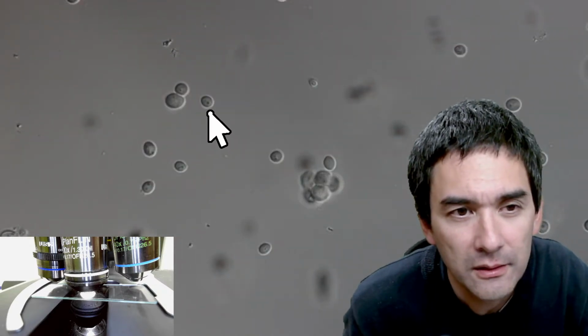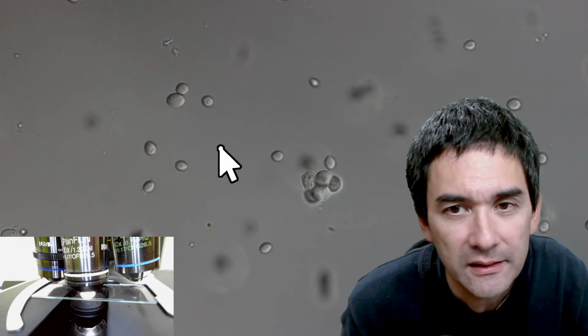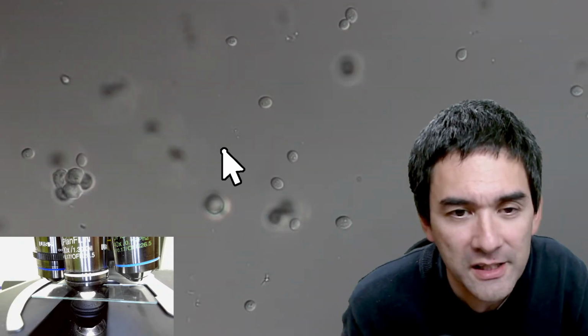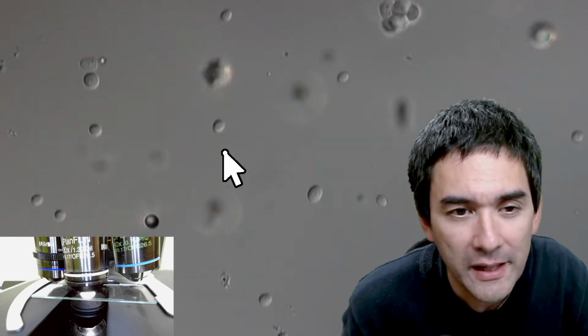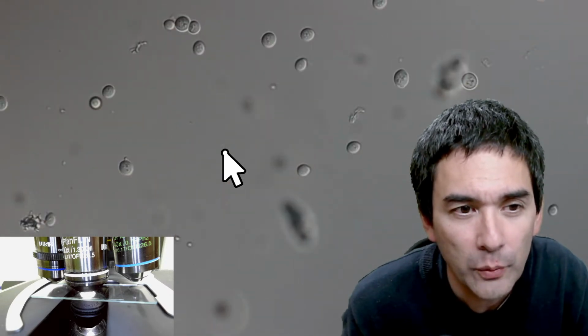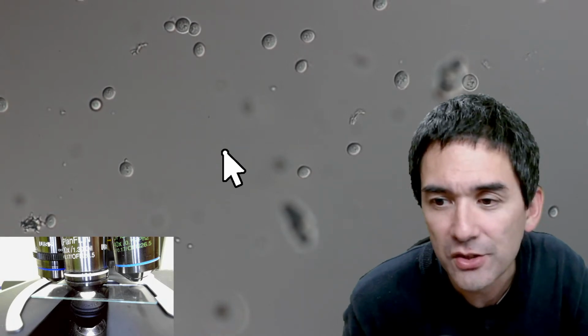Concerning the DNA, of course the two cells are genetically identical, however the cytoplasm is divided asymmetrically, and that's something that you cannot see here because I use dry yeast, so I have to add a little bit of sugar and wait a little bit, and then you're able to see this as well.